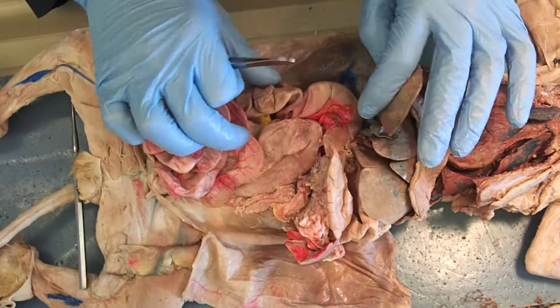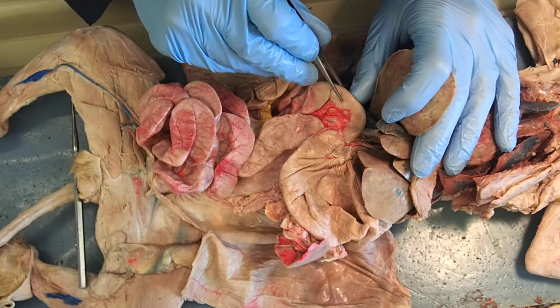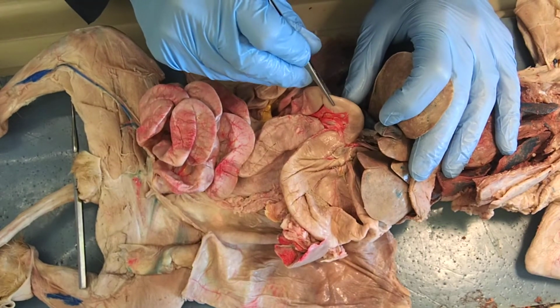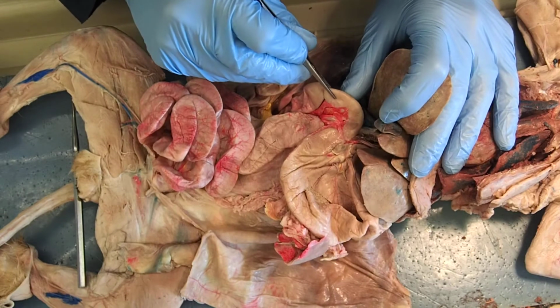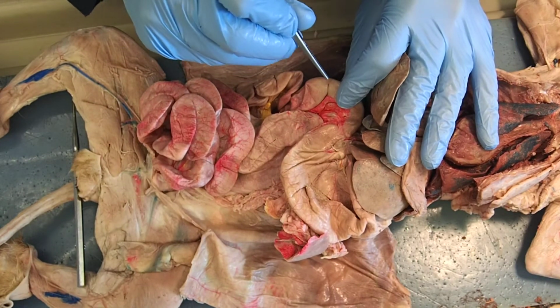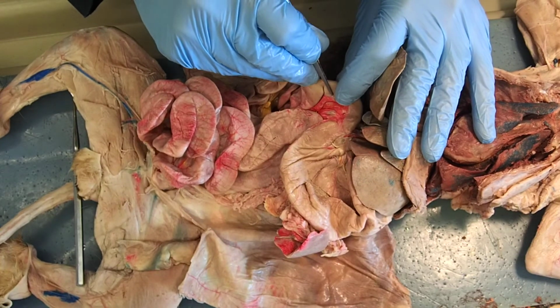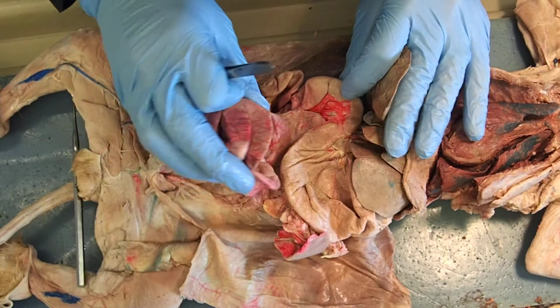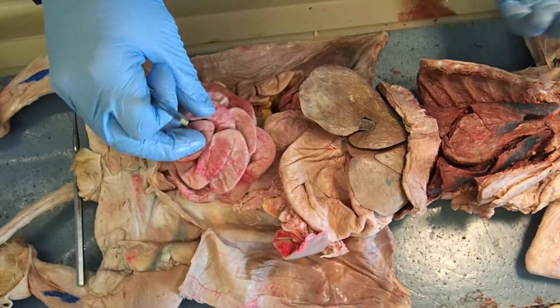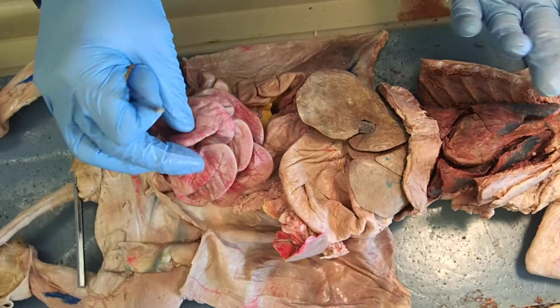And likewise, I could do it the other way. I could show you the stomach and say, what section of the small intestine is this? And which specific section would foodstuff then pass into after leaving this section? Well, if this is the duodenum, then the next section would be the jejunum. I can't just tag a piece of the small intestine and say, what is this? Because you really have no idea where we're at. All right?